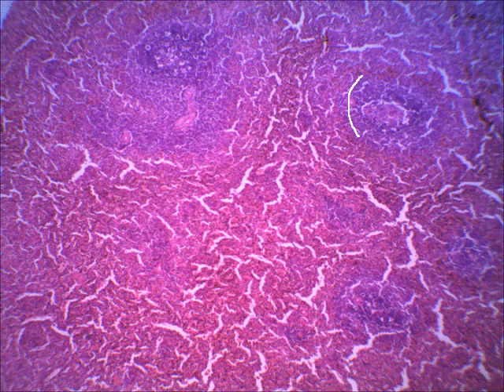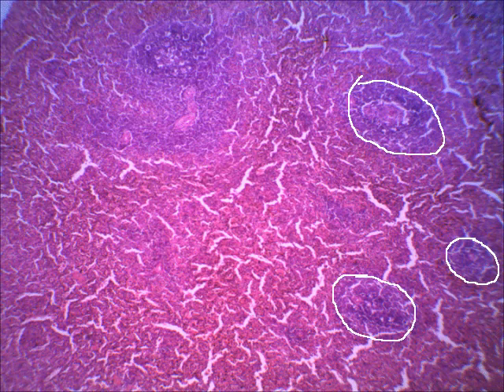And that's what you see right here. So this would be analogous to the lymph nodule in a lymph node. And then all these other spaces that you'll see, like here and here, this is where the red blood cells or the blood's going to filter through. So all of this area that surrounds the white pulp would be called the red pulp.